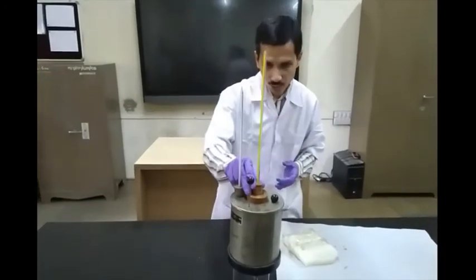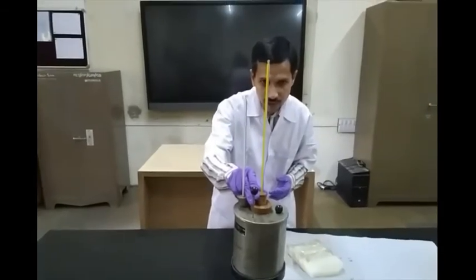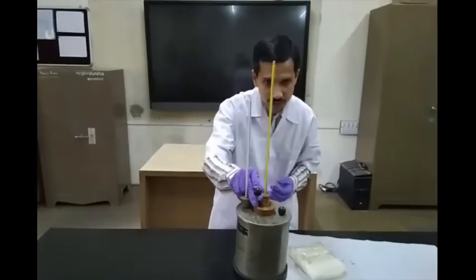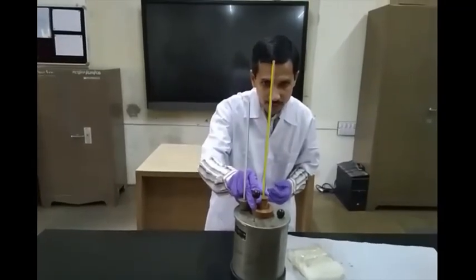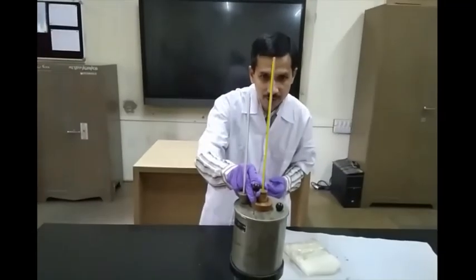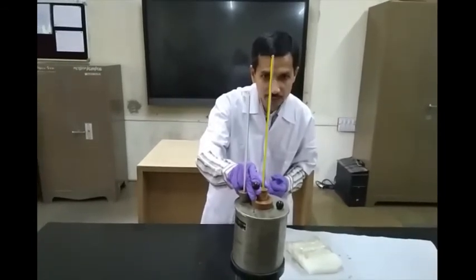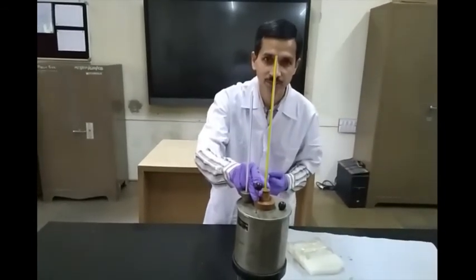We will be drawing a curve of time versus temperature, and that will exhibit a plateau. This plateau is nothing but the melting point of petroleum wax. So now the temperature is around 80 degrees Celsius and we start taking the readings until we get a minimum of 10 readings which have a constant value.